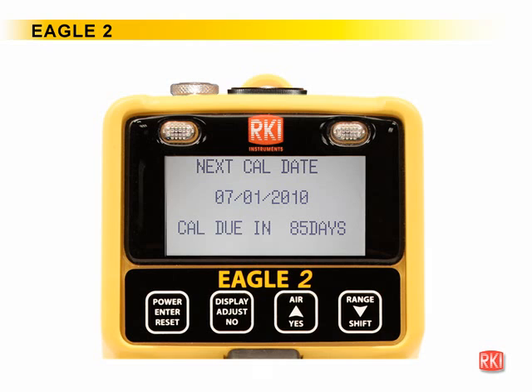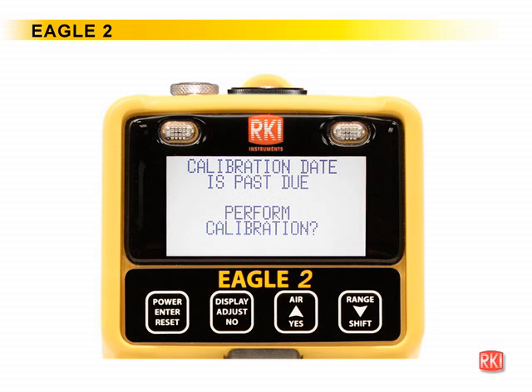If the unit is due for calibration and Cal Past Due Act is set to Confirm to Cal, then the following screen displays and the buzzer sounds in a double pulsing pattern. If set to Must Calibrate, then the following screen displays and the buzzer sounds in a double pulsing pattern. If set to Notification Only, then the following alert screen displays and the buzzer sounds in a double pulsing pattern.